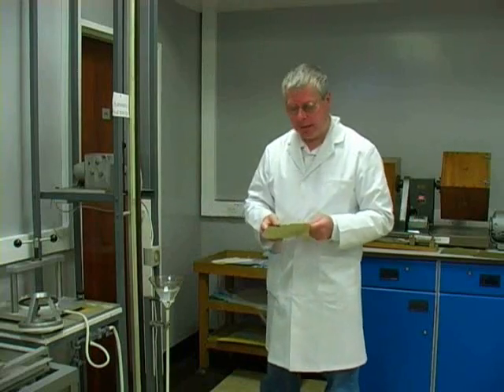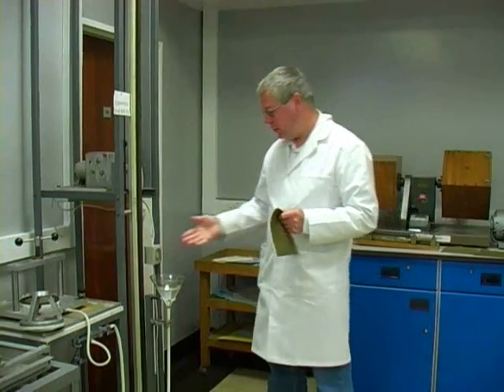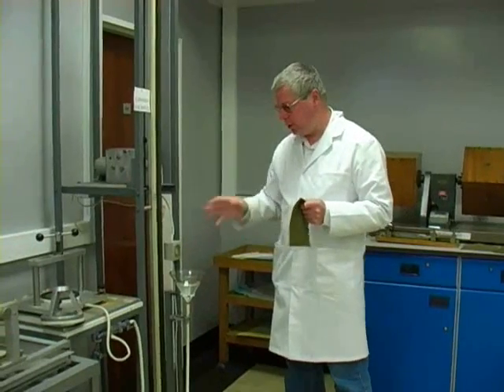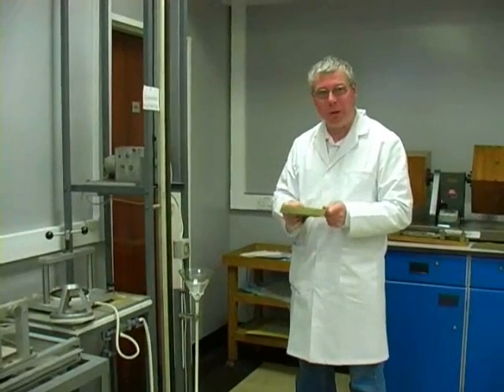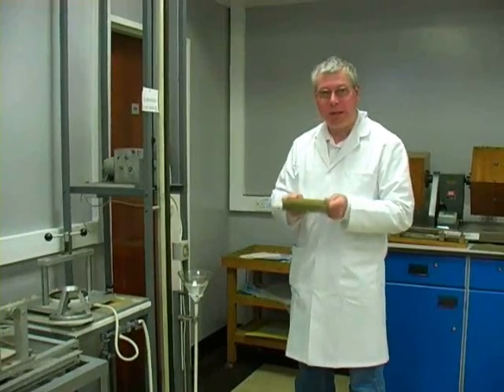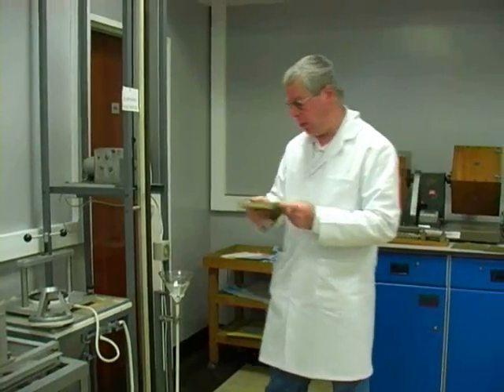This is the hydrostatic head test rig, and this raises a column of water until the water pressure is enough to force its way through the cloth. So this is the absolute waterproofness test for fabric.